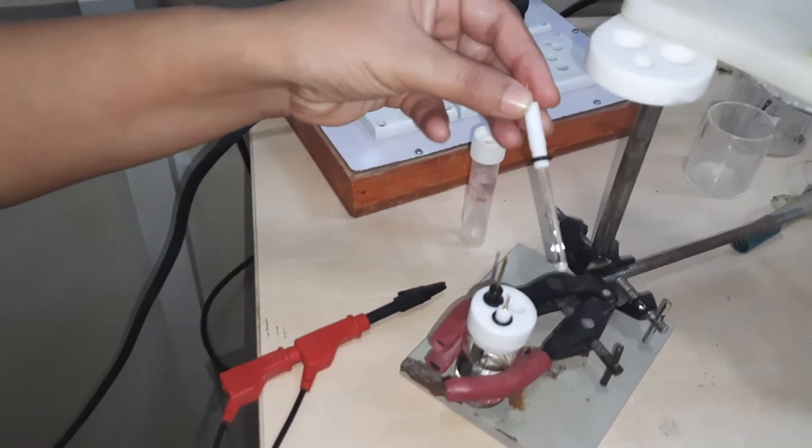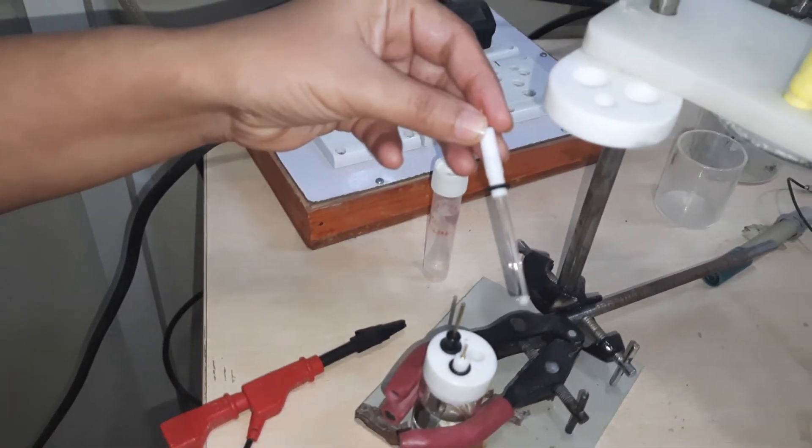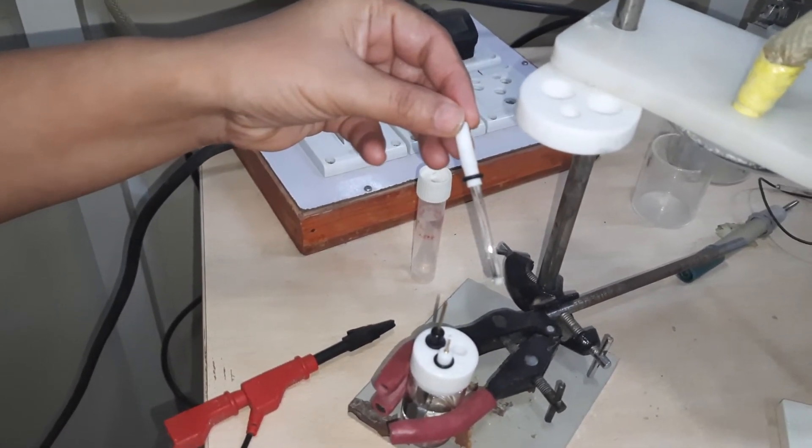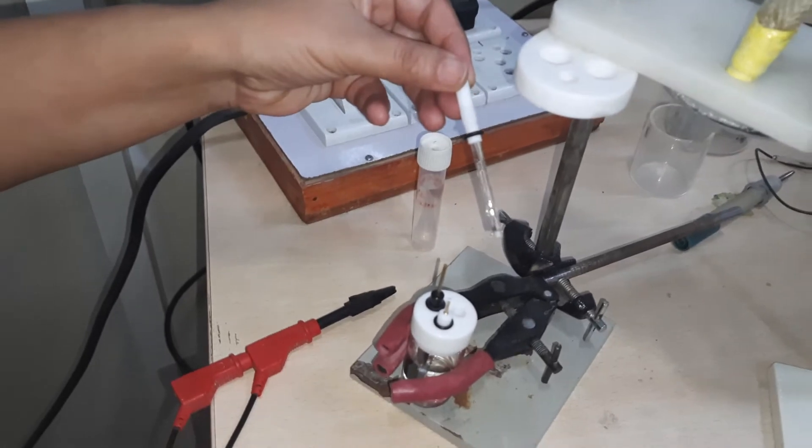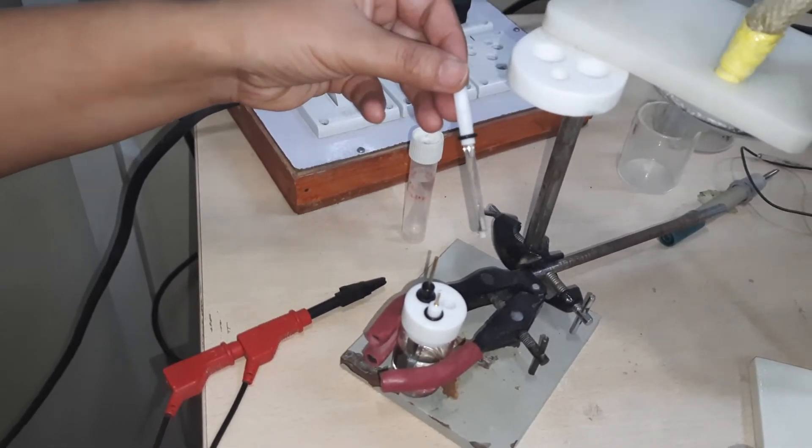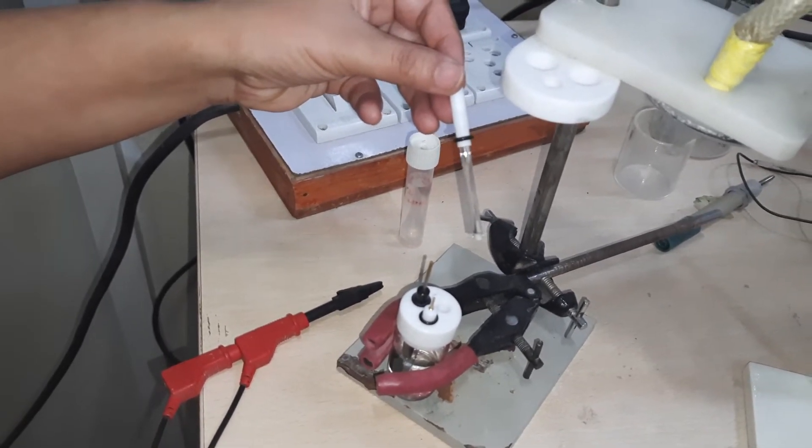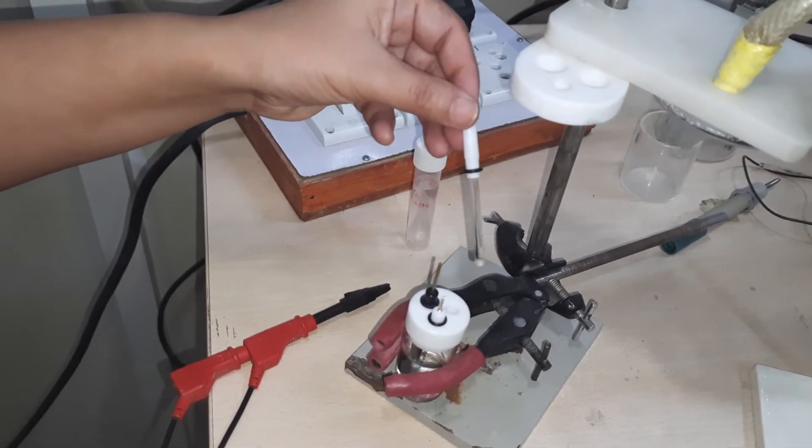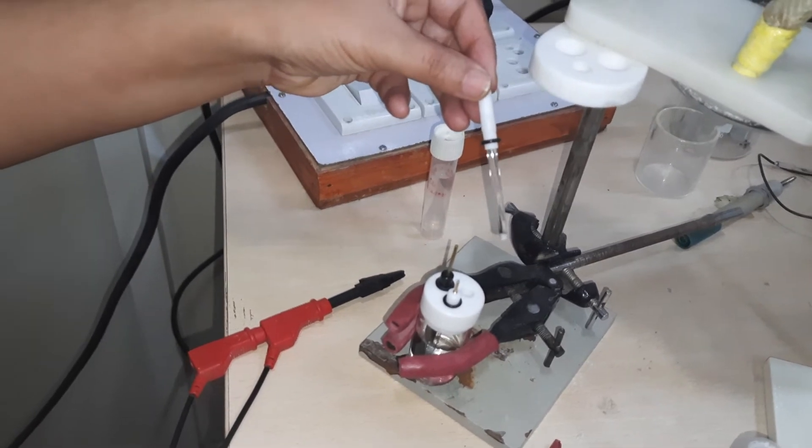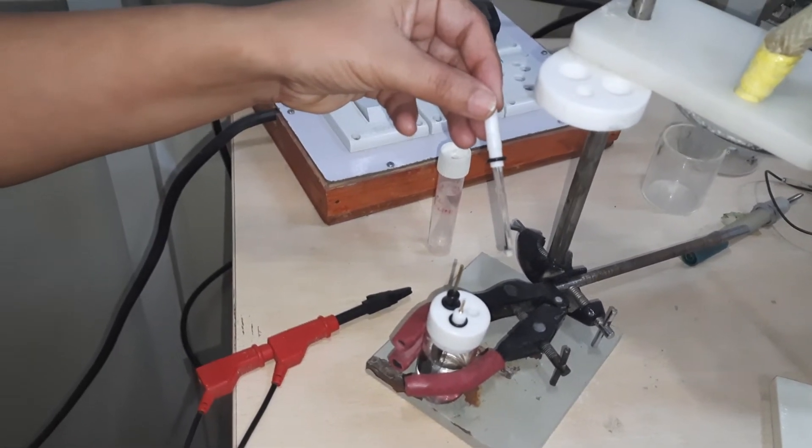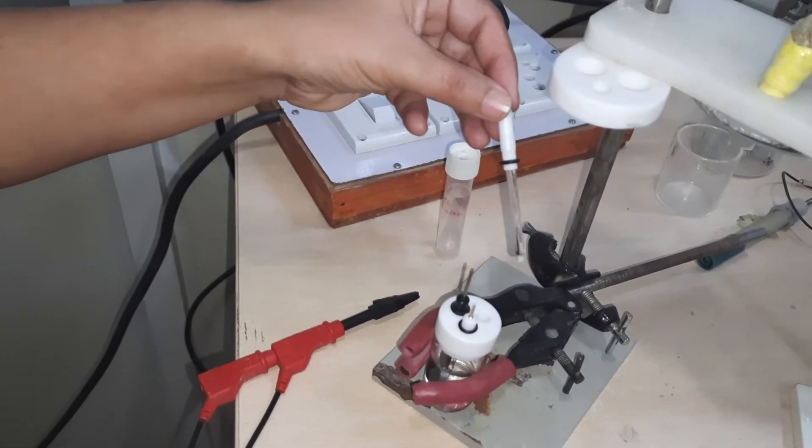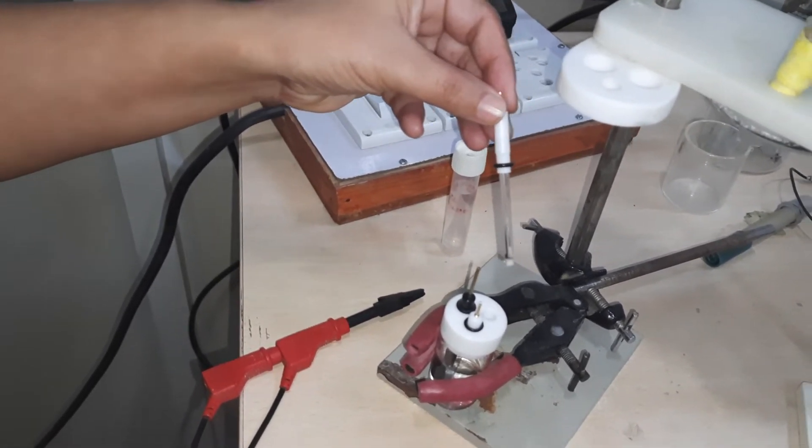In this case, we are going to record the experiment in aqueous conditions. This is a silver/silver chloride electrode that we are going to use for today's cyclic voltammetry experiment.